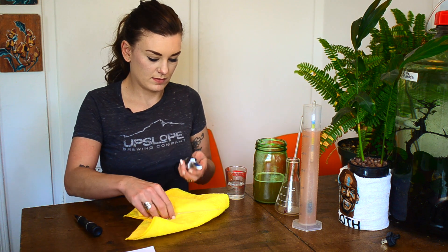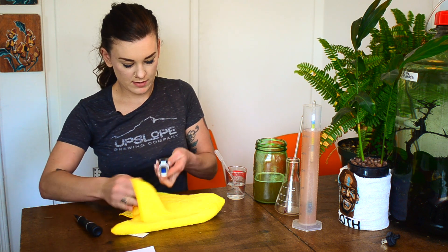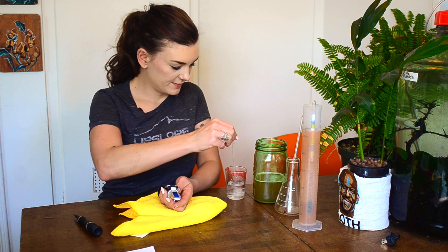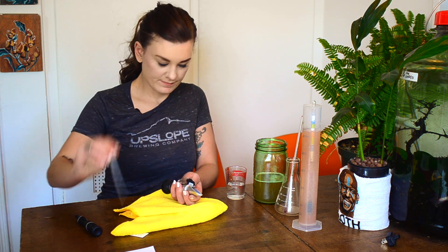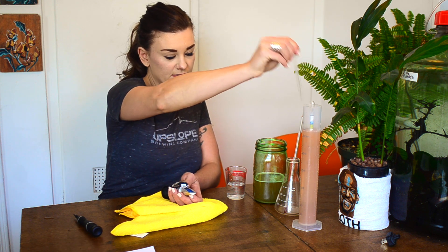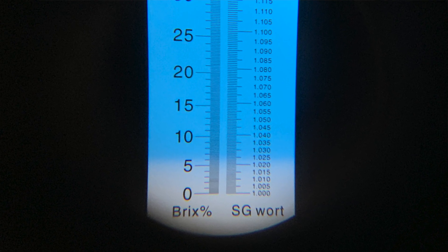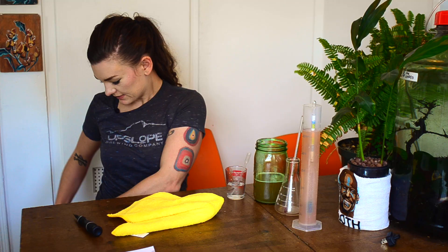Now I'm going to throw some water on, wipe it off, and make sure there's no liquid on it before the next reading. Taking some fermented wort now and dropping it on. It's usually fuzzy when you drop fermented wort on, so you just have to roll with it. This one isn't that fuzzy but it's definitely fuzzier than normal wort. I'm going to call it six Brix.